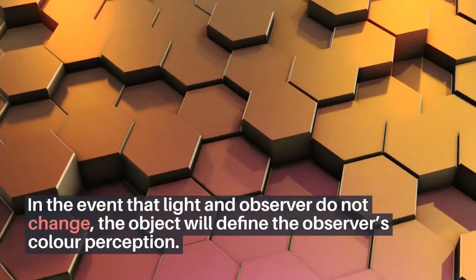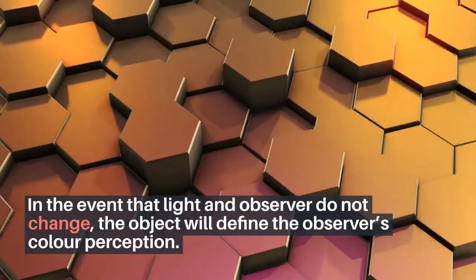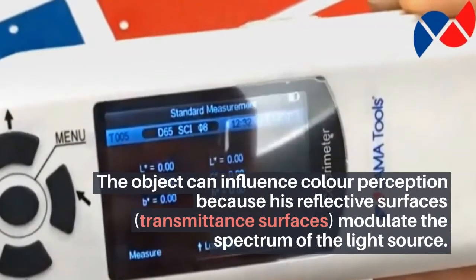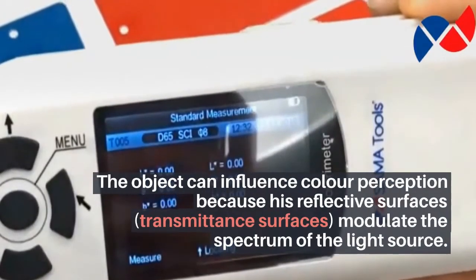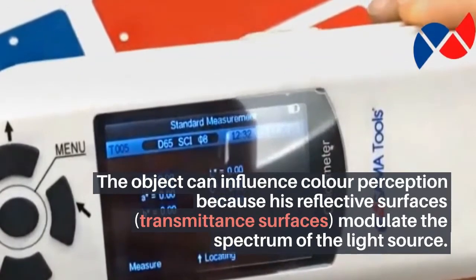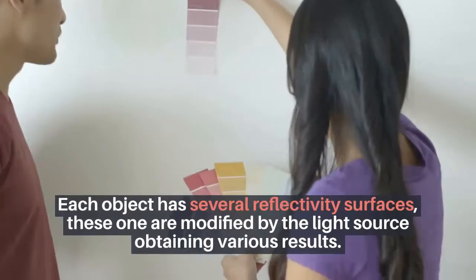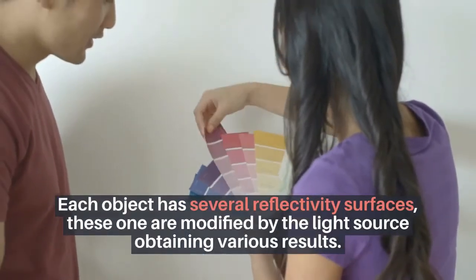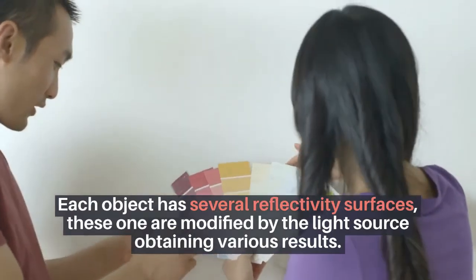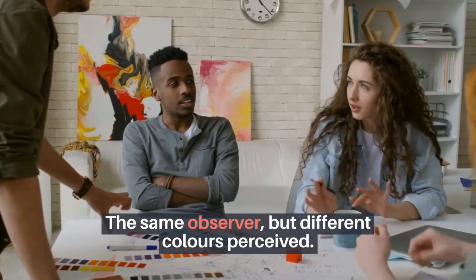In the event that light and observer do not change, the object itself will define the observer's color perception. The object can influence color perception because its reflective and transmittance surfaces modulate the spectrum of the light source. Each object has several reflectivity surfaces, which are modified by the light source, obtaining various results — the same observer but different colors perceived.